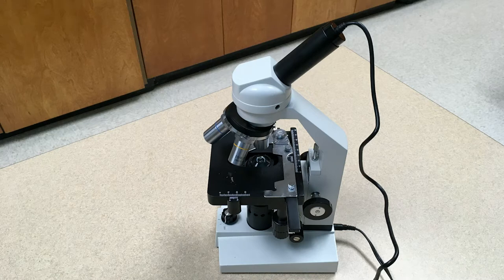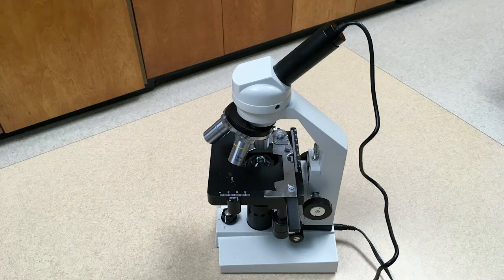It's best to use a microscope with 100 power magnification that has a mechanical stage to hold and move your slides around.